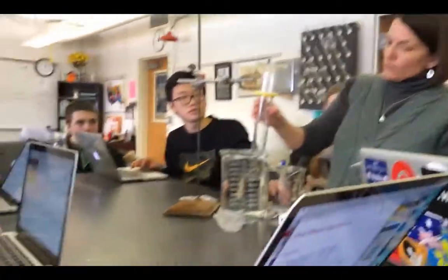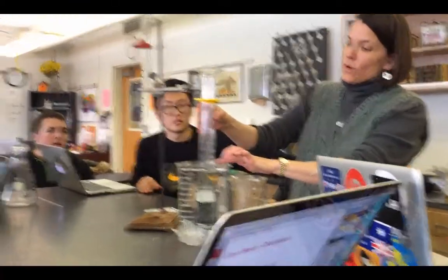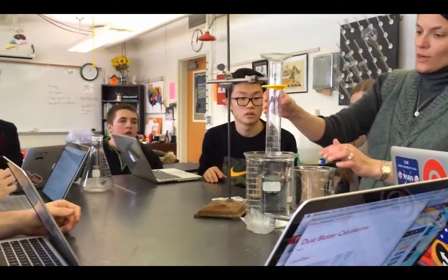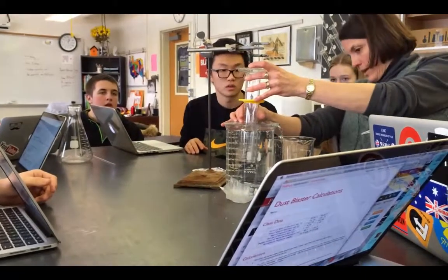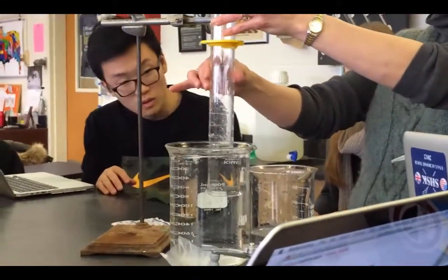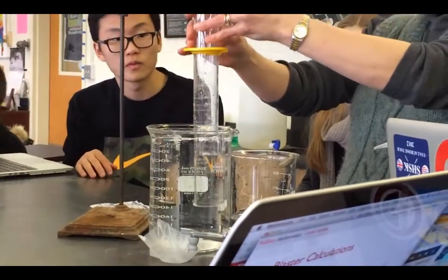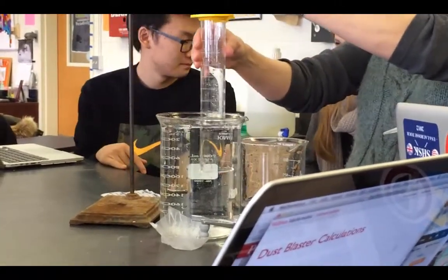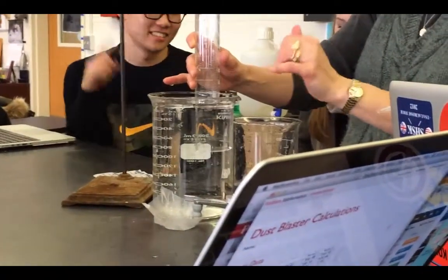Now watch what happens here. This is what happens when you change the volume. Now watch what happens to the water level. We're right about 240, but when I lift it up, it goes under the mark, and when I push it down under the water, it also goes down lower. The reason why we measure it right here is because that's the point where the pressure inside is equal to the pressure outside. So if we put it down below, we're altering the pressure a little bit, so it's changing the volume. And in our final lab, you're going to have a large graduated cylinder, and you're going to have to do that step too before you measure your volume.